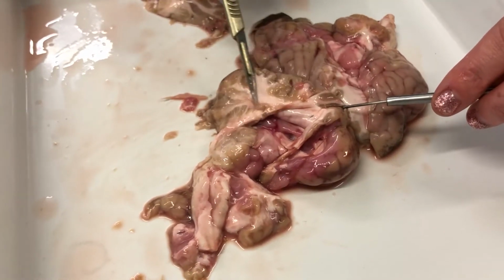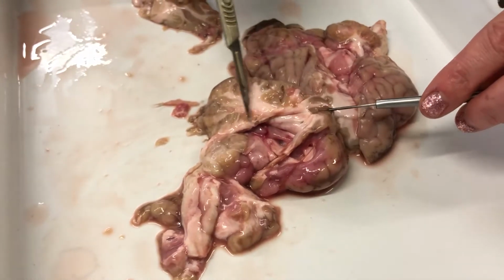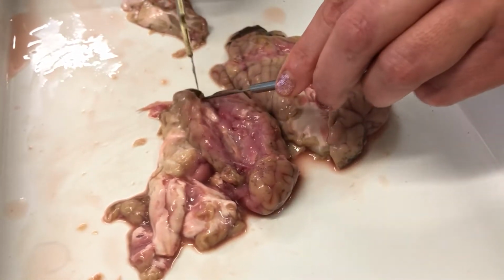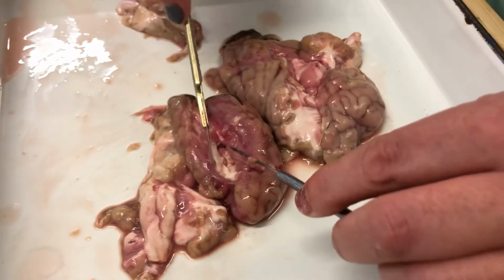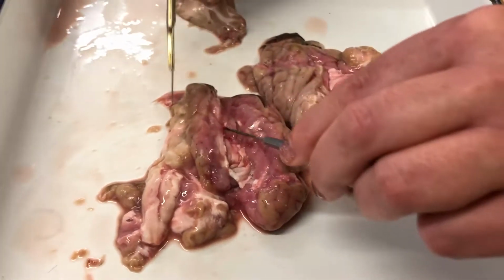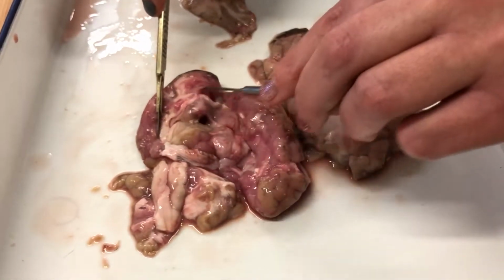And this is all the cell axons, so the bits that connect this bit of the brain to the other bits. Okay, so if I was to slice properly down the middle of the brain, because this is already partially dissected, you can see that it seems to be connected by this white tissue. That is called the corpus callosum. And now I've severed the corpus callosum here.